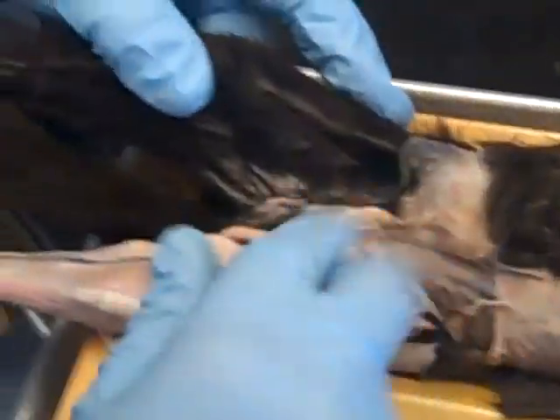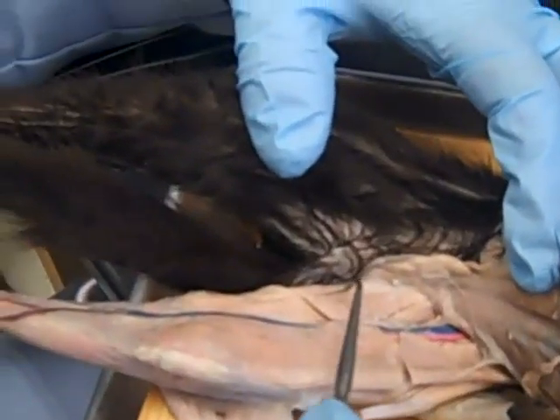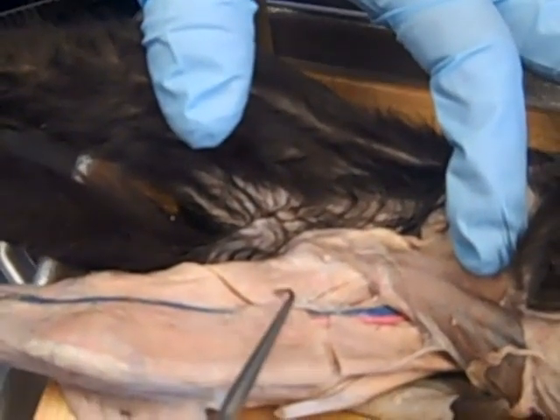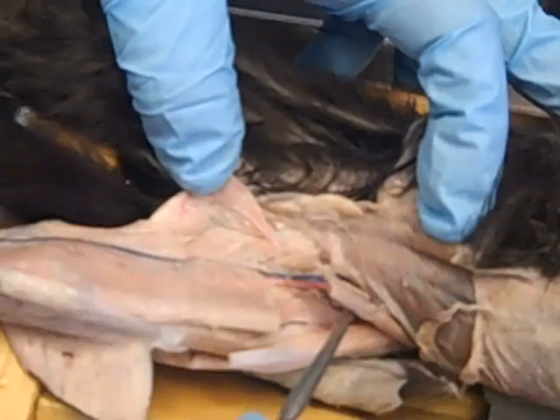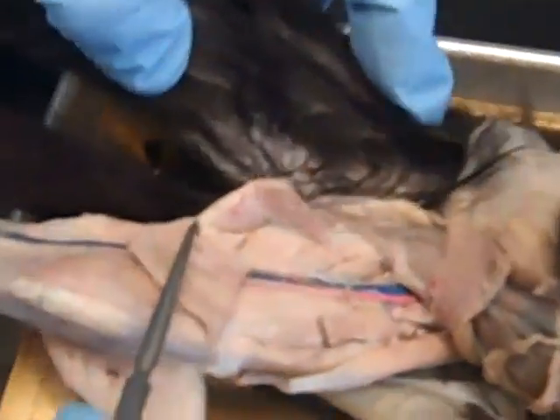This cat didn't have its pelvis split because some lazy person didn't do it, but we have a muscle here and a muscle here that are cut. This one is the gracilis, and this one is the sartorius, so take those back.